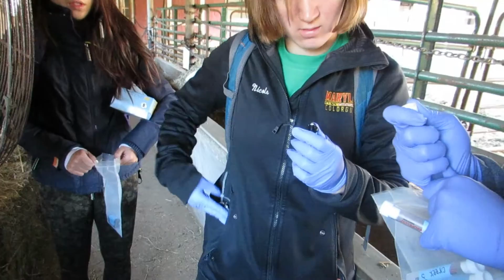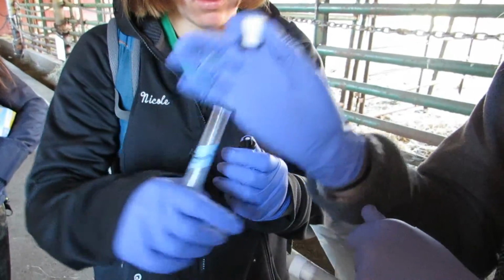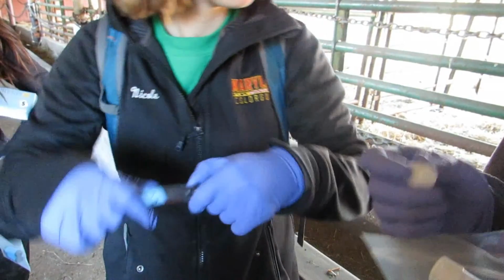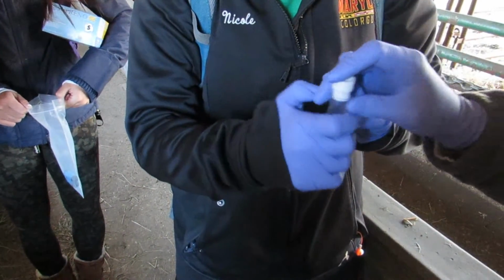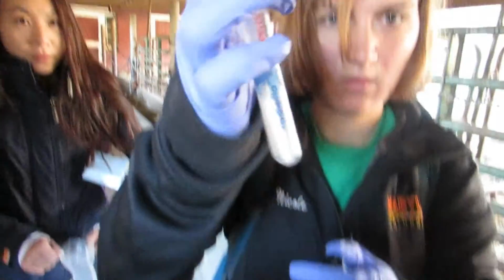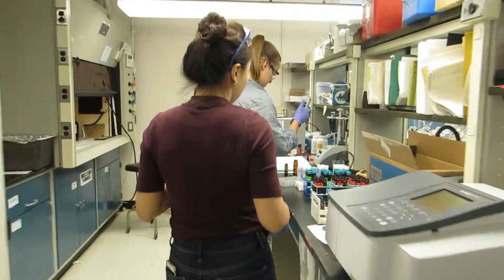The plate was unscrewed and the tube was placed on top of the diffuser. Holding it together, then turning it upside down, the cartridge emptied into the tube. The tube was capped and the time of sample collection was recorded. The process was repeated for each sample. The samples were then taken to the USDA lab for analysis.